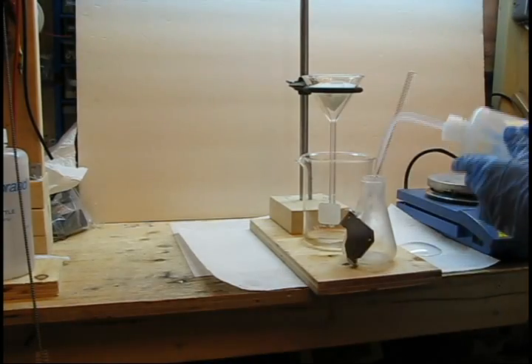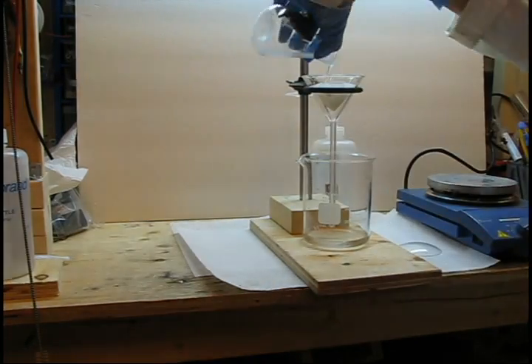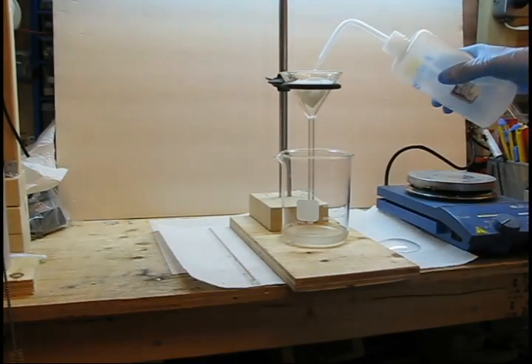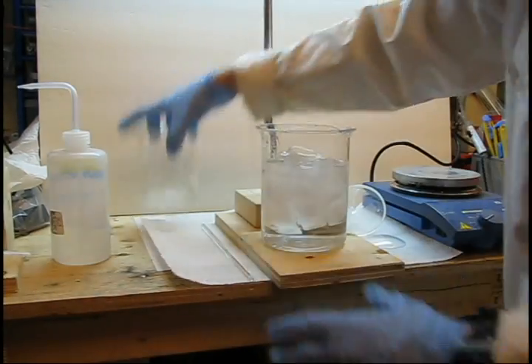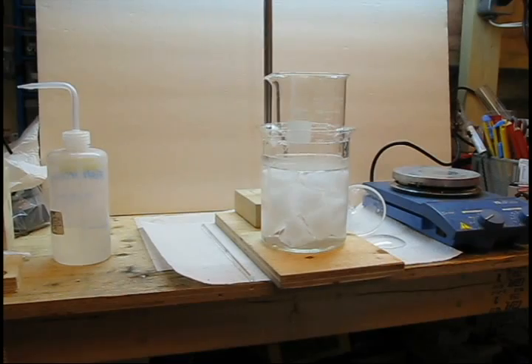Wash the flask with isopropanol to collect any residues. Wash the solids with isopropanol and dispose of the solids carefully. Place the beaker with isopropanol solution into your ice bath.